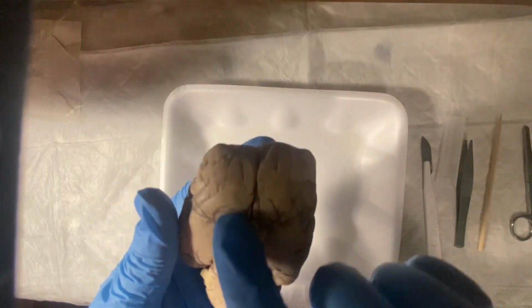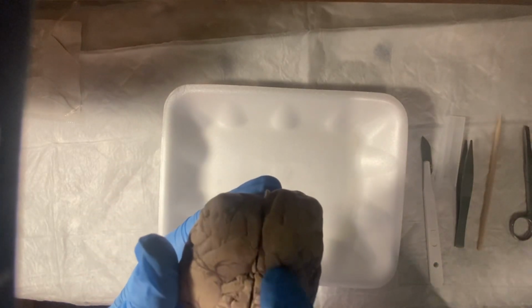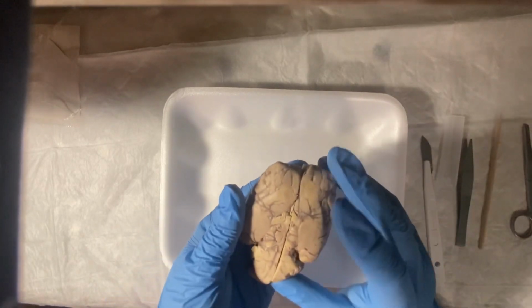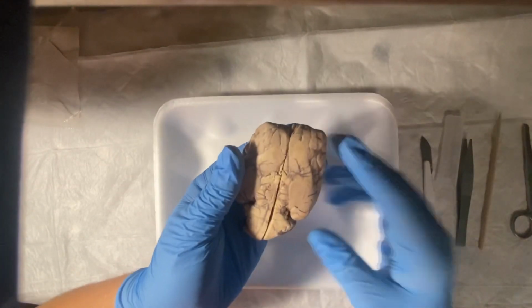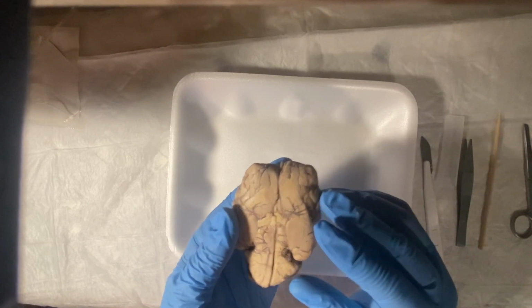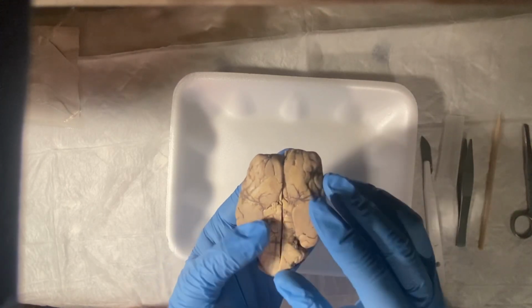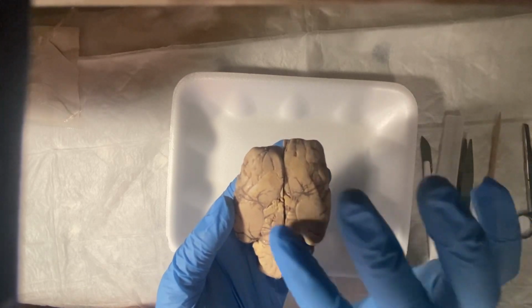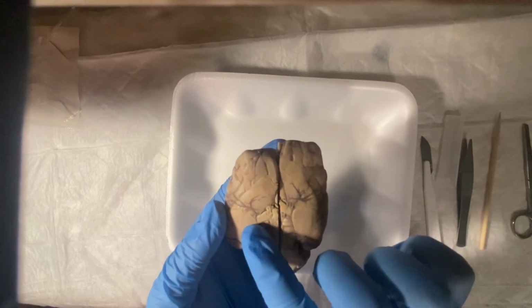Optic nerve, and that is in front of the optic nerve, okay. And behind that would be cranial nerve number 3, oculomotor nerve, and that is around here. Pretty small, but the oculomotor nerve.